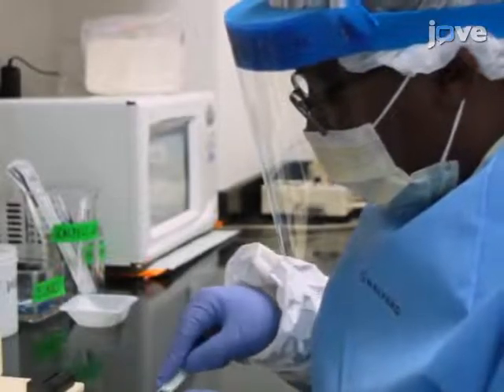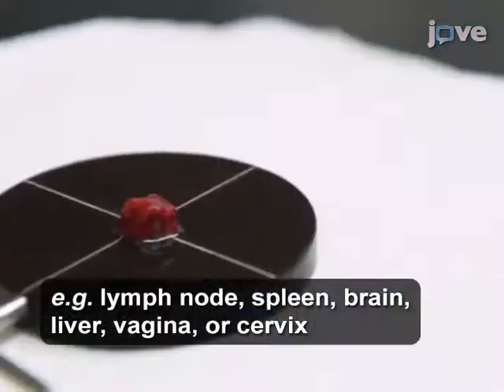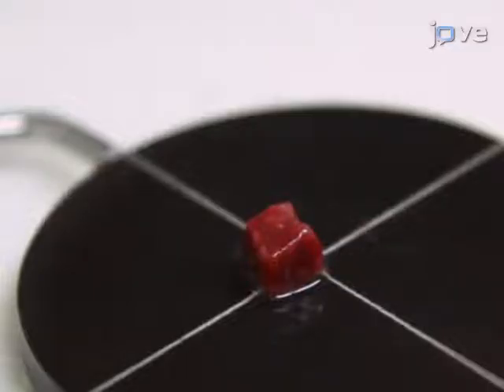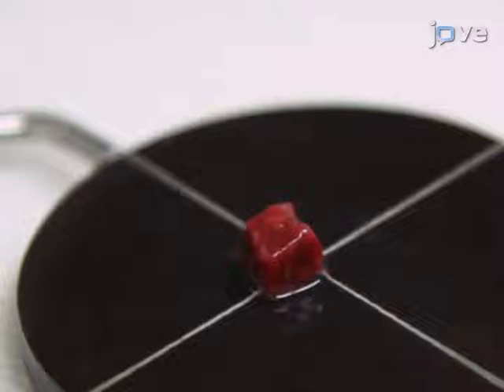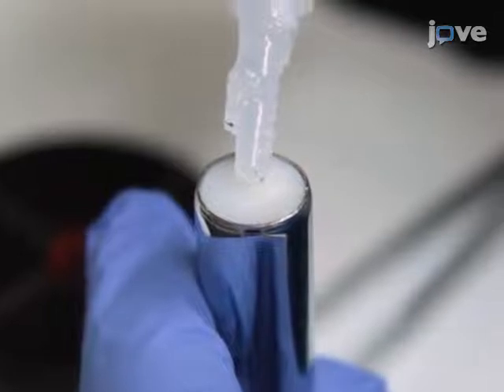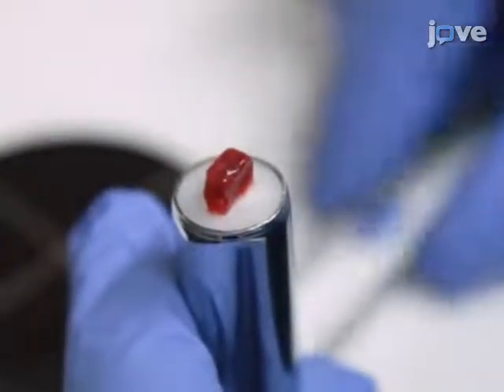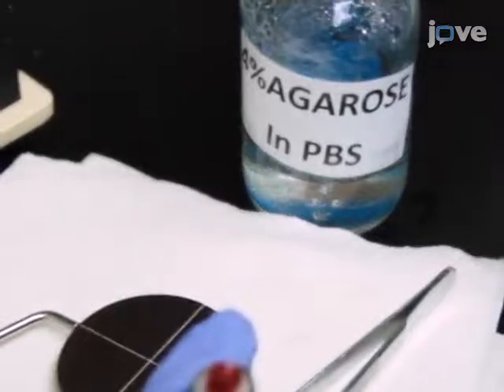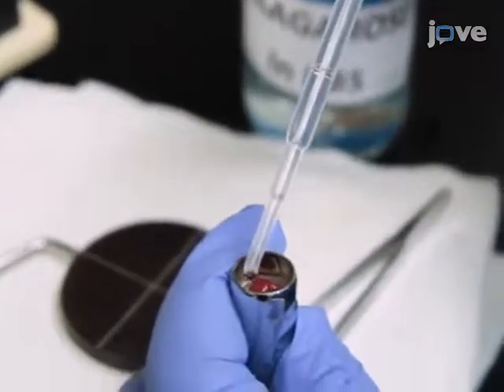On day one of the procedure, use a scalpel to cut the fresh tissue into approximately 0.5 by 0.5 centimeter pieces. Here, Rhesus macaque spleen tissue is shown. Separately glue each tissue fragment into the middle of the top of a plunger and embed the samples in 3 to 5 milliliters of warm, 4% low-melting agarose in PBS.